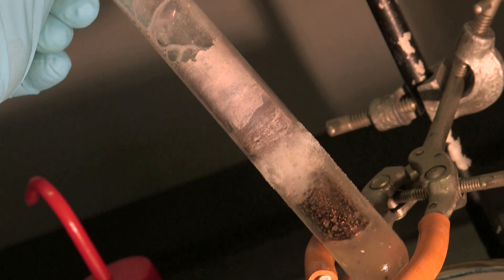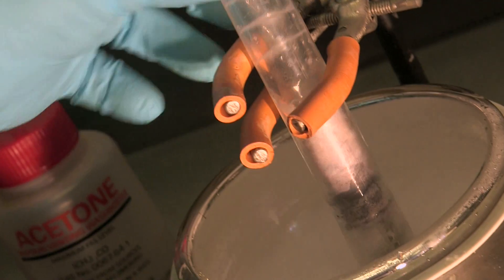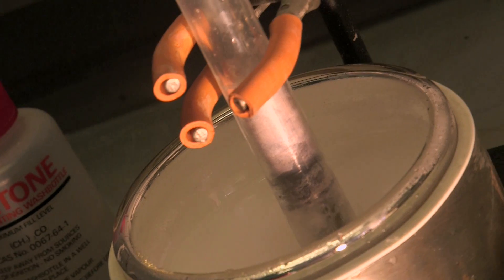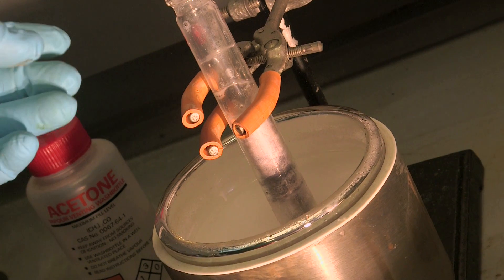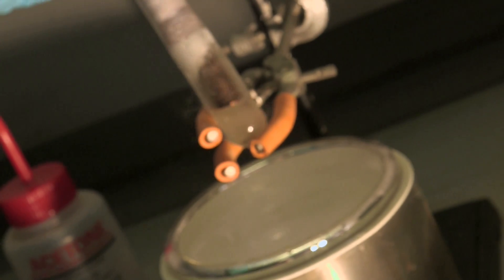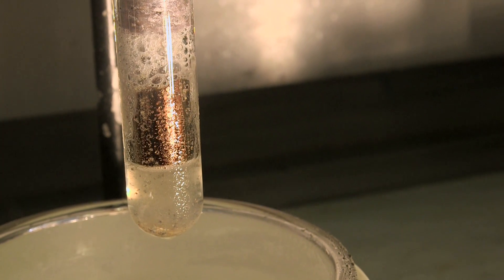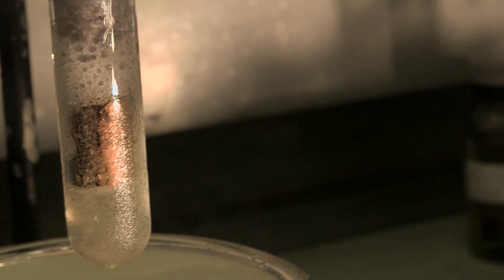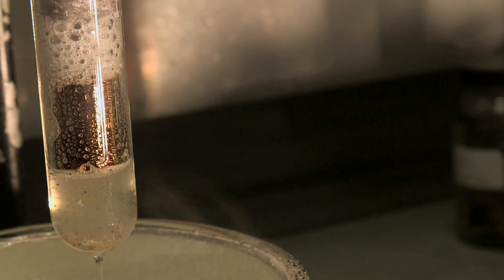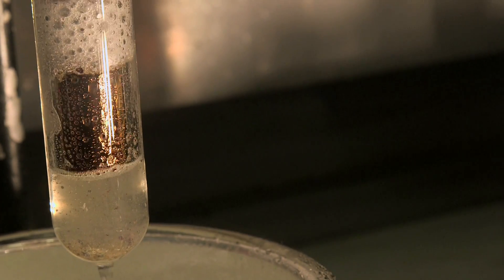What's going on at the top there with that crusty sort of powdery-ness? This white stuff up here could be... It's either sodium amide or sodium isopropoxide which is also a white solid. So that is really quite pretty there. Clear again. Look at that. That is very pretty.